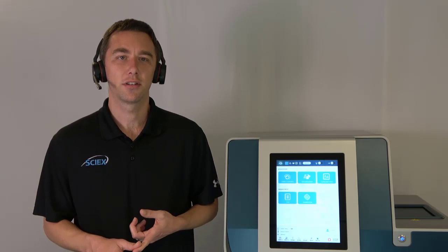We're here to discuss the capillary gel electrophoresis workflow for AAV genome integrity analysis that's going to allow us to not only determine the AAV genome size, but we're going to take a look at that genomic purity, that transgene integrity. We're going to see how we can calculate the genomic titer, and also look at some other potentially process-related impurities. By the end of today, I'll show you how you can calculate a reliable full-to-empty capsid ratio for your AAV products.